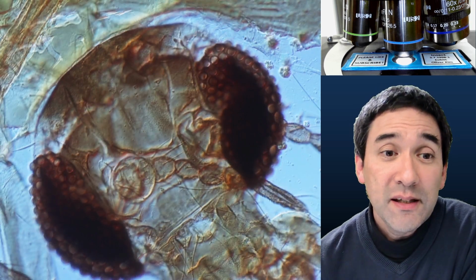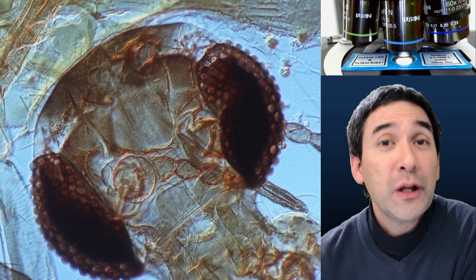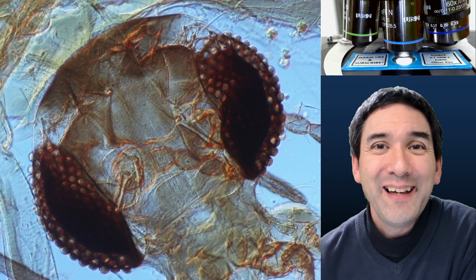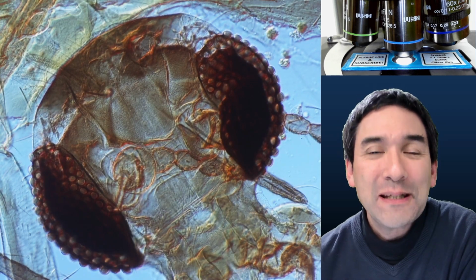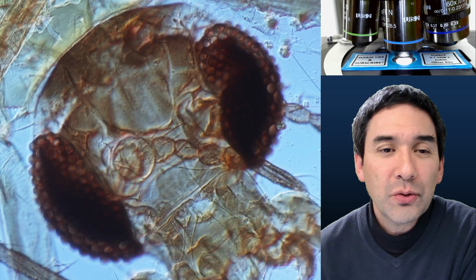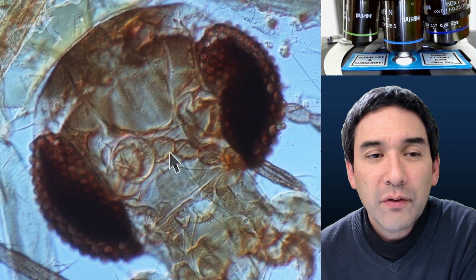And in this case, even though I used Eukitt, I think some kind of natural bleaching has also occurred because the insect is still relatively transparent, with the exception of the eyes, which are highly pigmented, of course. But you can also see over here the individual ommatidia, which are the simple eyes of an insect. And even look, let's turn on the arrow again here. We can even see over here a little bit of the antenna of the insect.